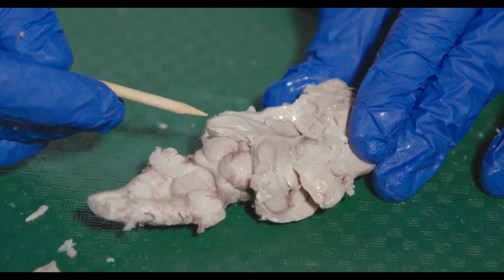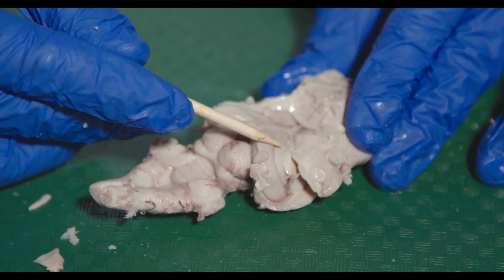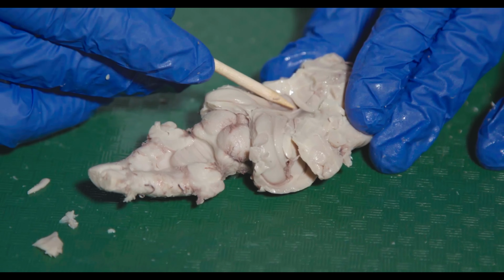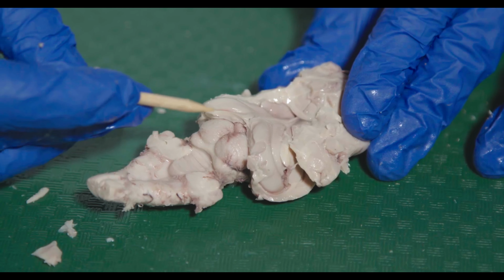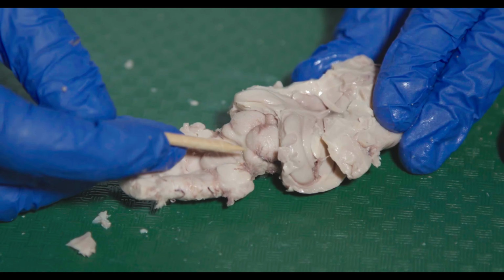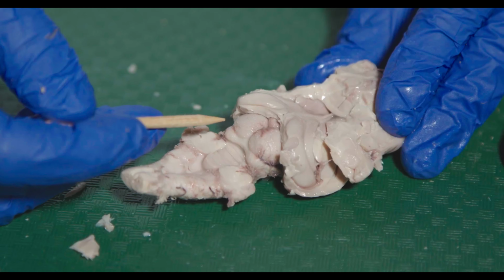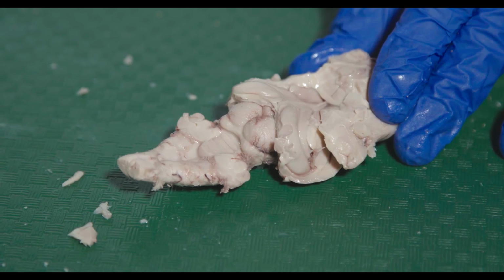The hippocampus has these fibers that come out that form the fimbria, and they come together to form the fornix. Again, that's going all the way down, and it'll actually send projections to the mammillary bodies. You can see the pineal gland, the tectum, superior and inferior colliculi, which is review, and then we cut the cerebellum so that we could see the cerebellar peduncles.